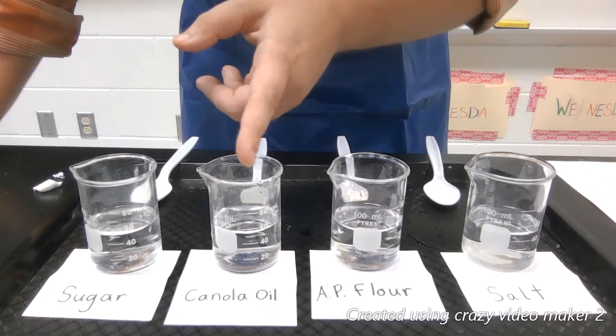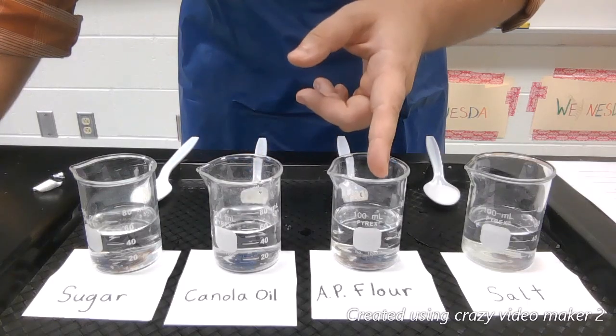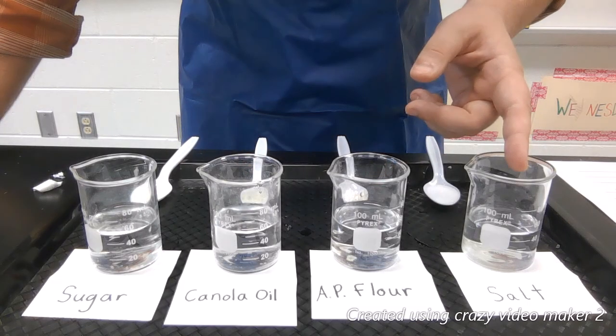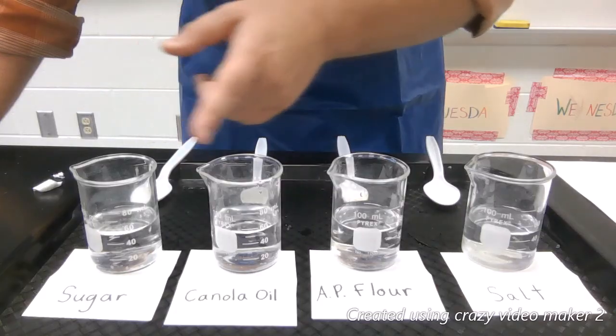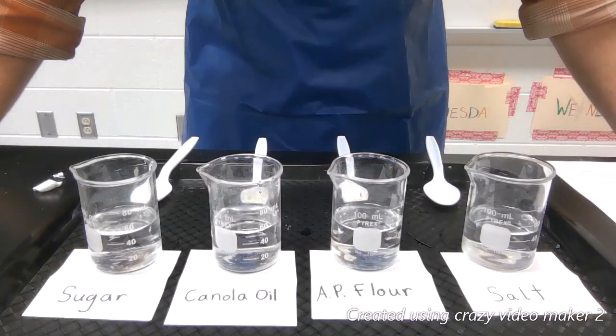I have sugar, canola oil, all-purpose flour, and salt. Each of these beakers has 50 milliliters of water.